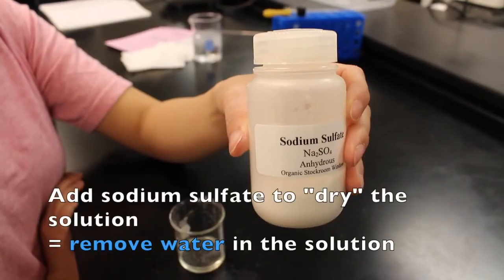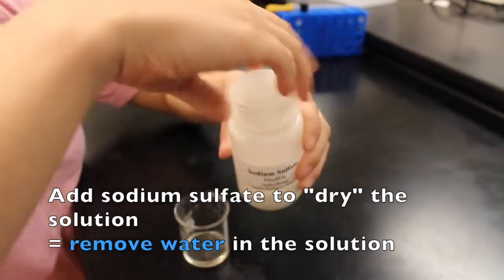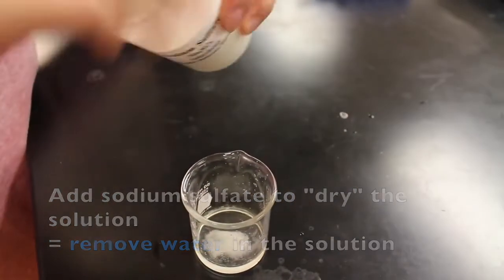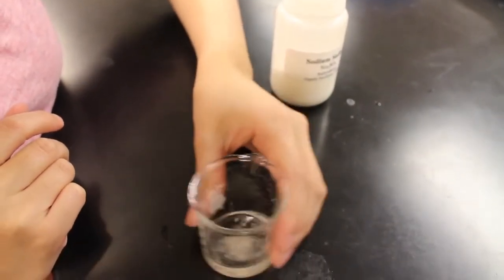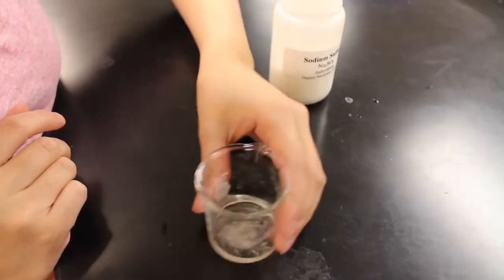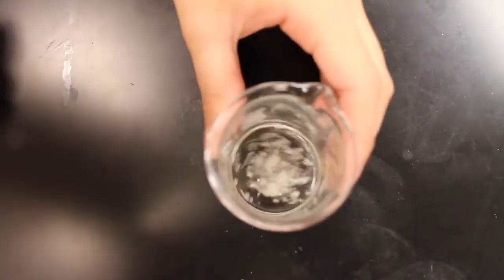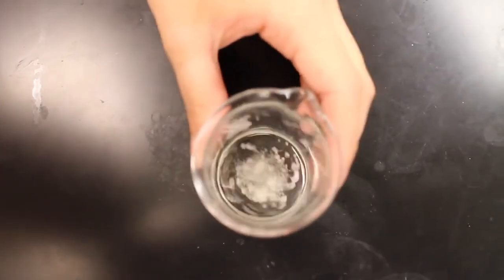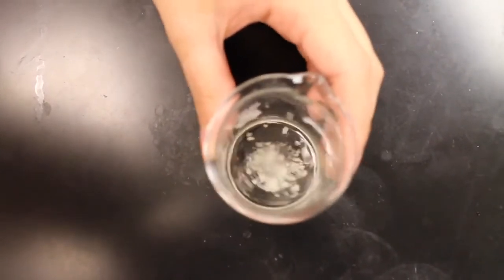Now we are going to add sodium sulfate into the organic solution we just extracted to dry it, meaning remove all the water left in the organic solution. As you're swirling the beaker, you'll see the clumping part and some free or loose pieces in the solution. The free or loose pieces let you know that there's no more water left in the solution, so you can stop adding sodium sulfate once you see those pieces start to form.